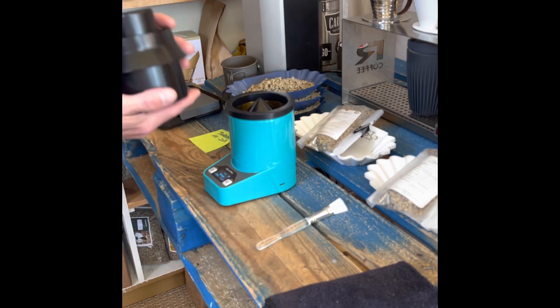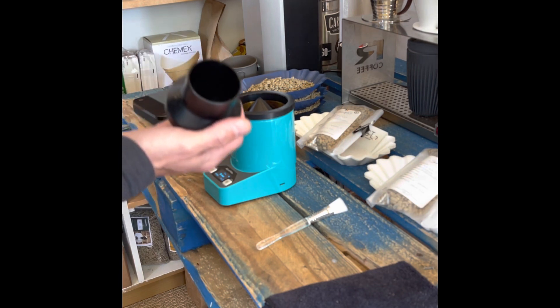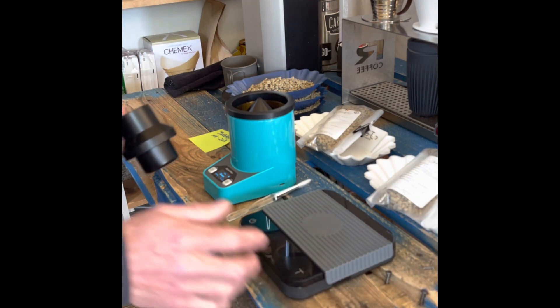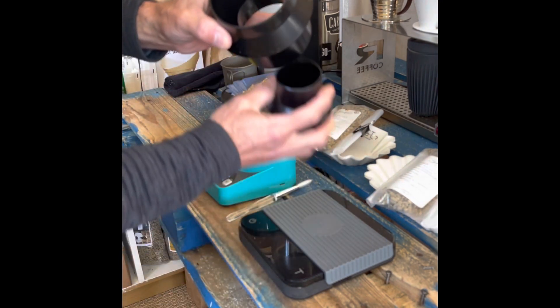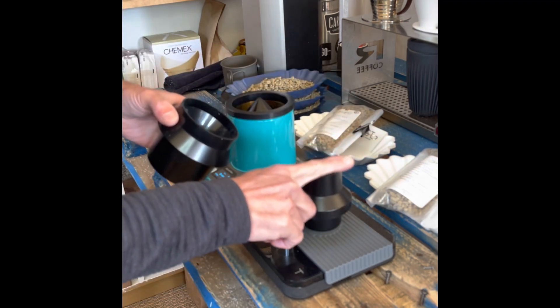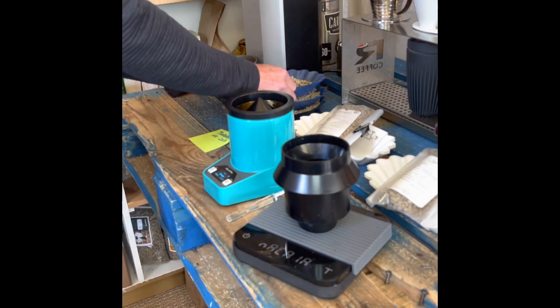This is the top and the hopper — you use this top and the hopper together. This is what we actually fill. We're going to measure this amount of green coffee into the chamber. When I put it on the scale earlier it was around 130 grams, so most green coffee samples — as long as you're getting 150 grams or more — you'll have enough to complete this. You put this down, then put the hopper on, which helps fill in the gap so we don't get too much and can accurately measure a full cup every time.